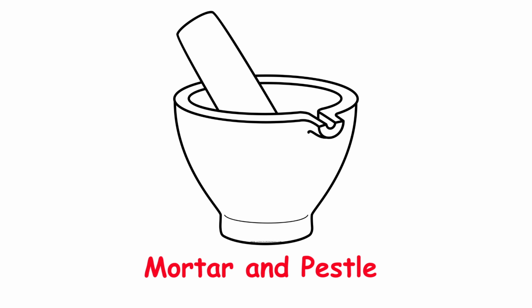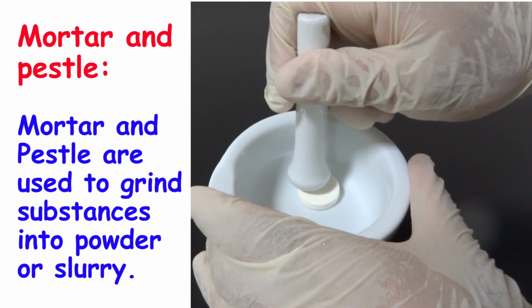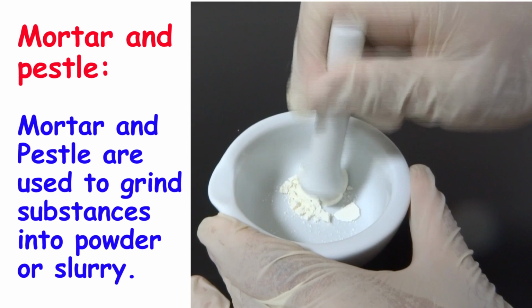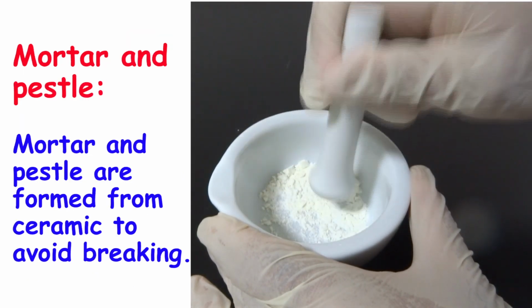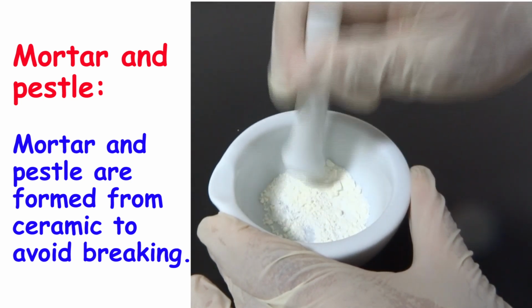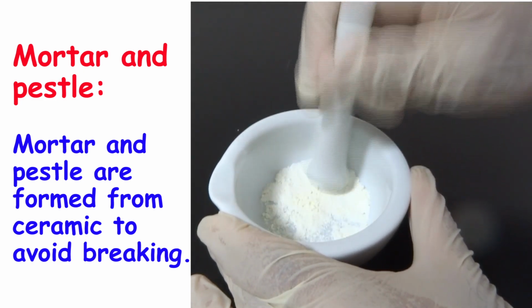Mortar and pestle. Mortar and pestle are used to grind substances into powder or slurry. Look how this tablet of vitamin C is turned into powder. The other lab tools are formed from glass, while the mortar and pestle are formed from ceramic to avoid breaking.